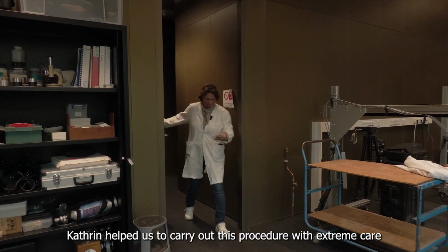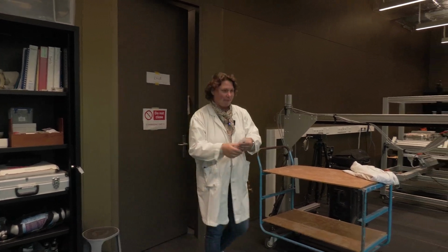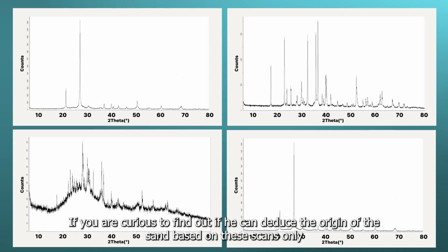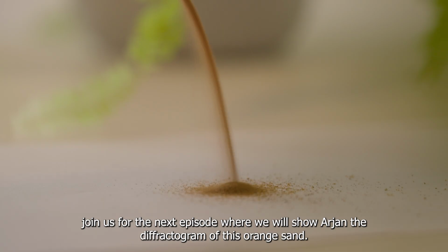Katrin helped us to carry out this procedure with extreme care, which resulted in these diffractograms that we're about to show Arjan. If you're curious to find out if he can deduce the origin of the sand based on these scans only, join us for the next episode, where we will show Arjan the diffractogram of this orange sand.